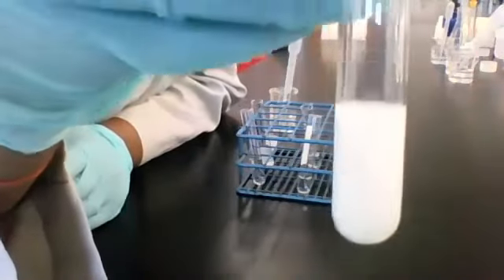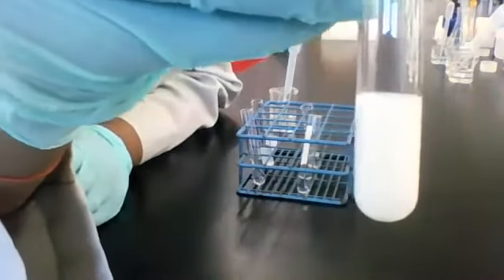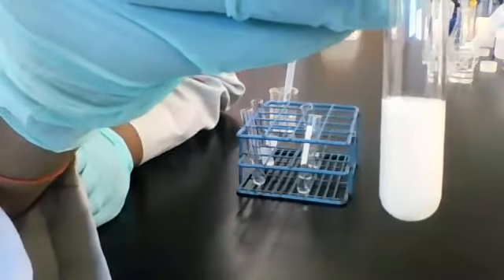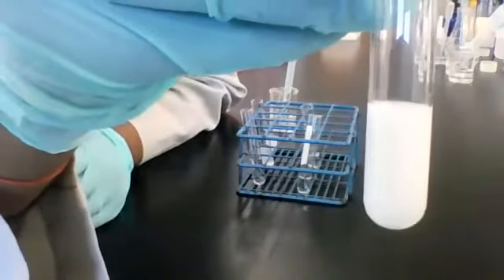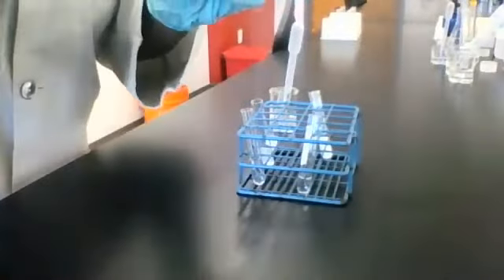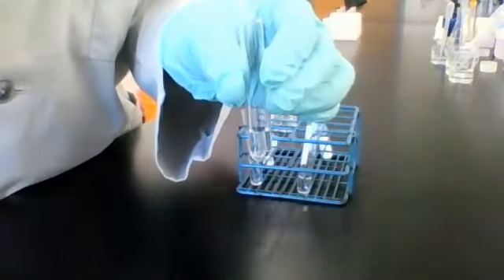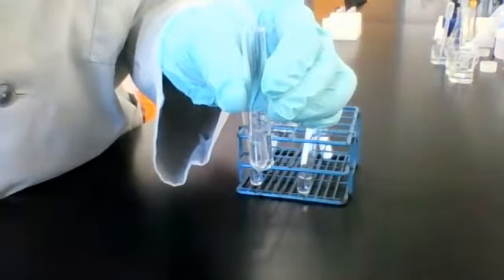So you write your observations. This is for solution 4 mixed with reagent C. All right, okay. Solution 5, which we know to be water. Let's add some reagent C, and we should already know what's gonna happen.